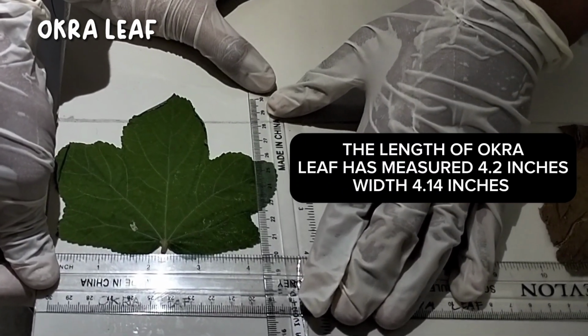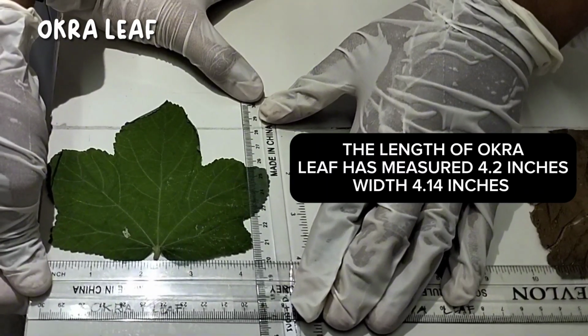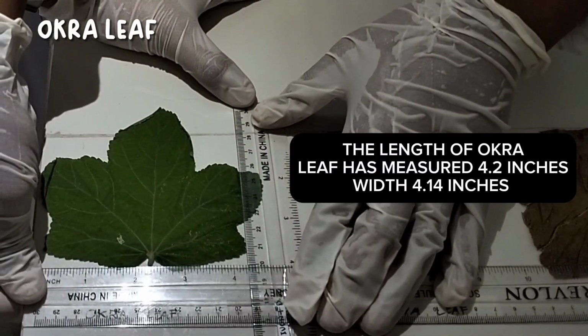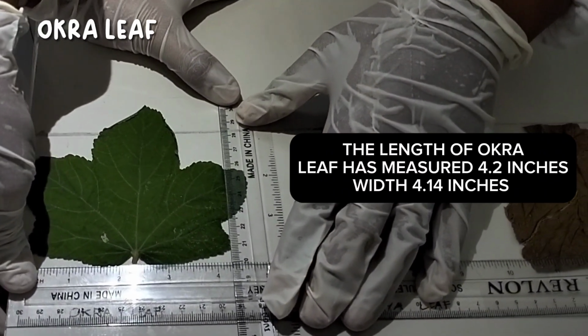The length of okra leaf has measured 4.2 inches and the width has measured 4.14 inches.